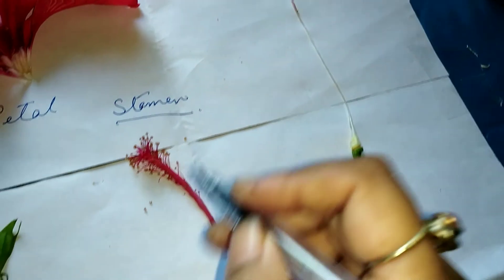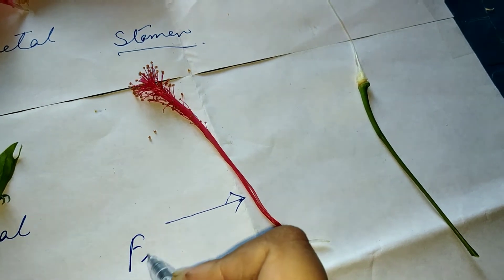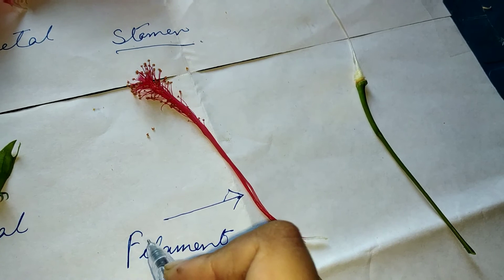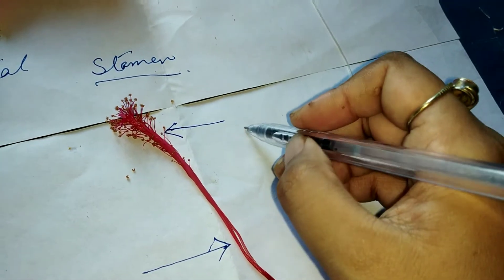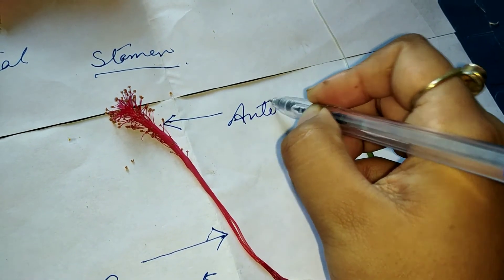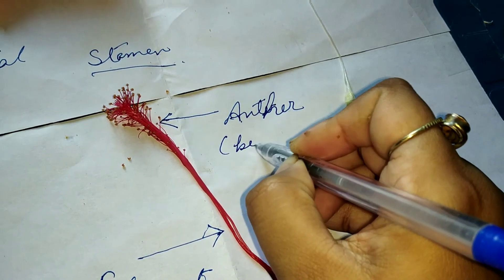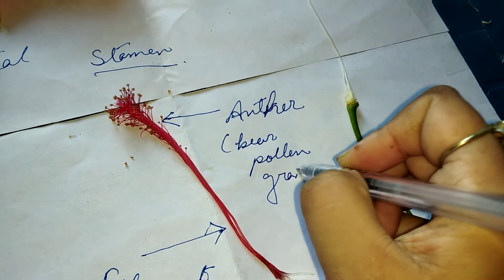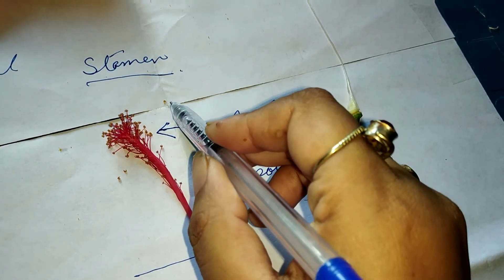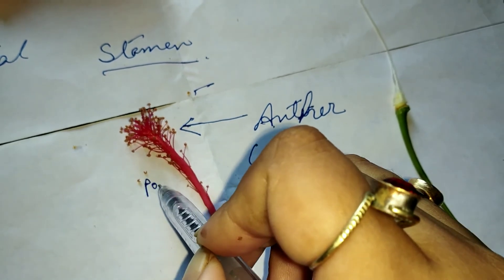What are the parts of the stamen? The stamen has two parts: the filament — F-I-L-A-M-E-N-T — and the anther. The anther is this upper part which bears the pollen grains — A-N-T-H-E-R. The anther bears the pollen grains. The pollen grains are the yellow granule-sized objects you can see — these are all pollen grains.